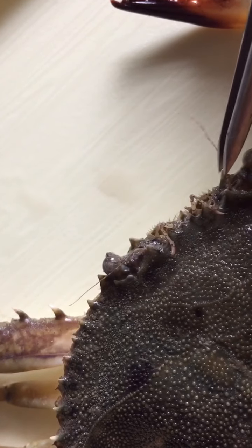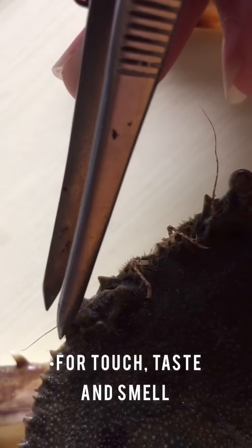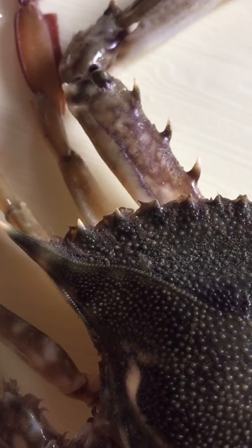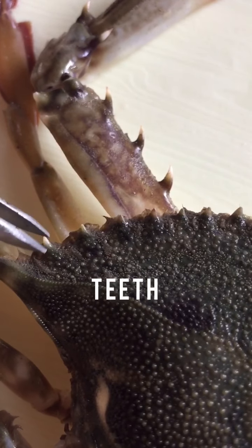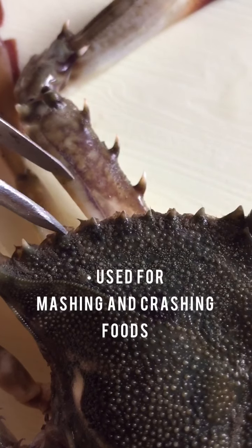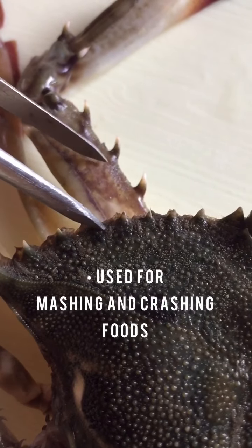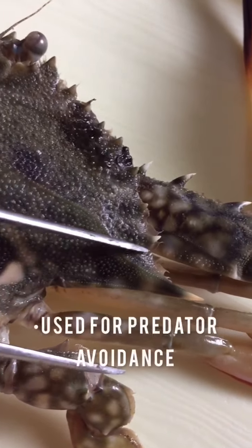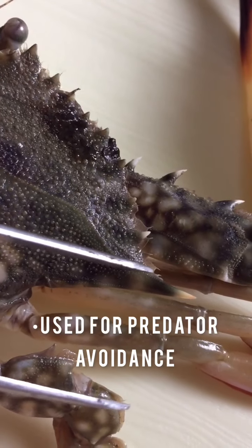We also have the antennae, which are the organs for touch, taste, and smell. The crab also has teeth, which are used for mashing and crushing food. We also have the two lateral spines, which are used for predator avoidance.